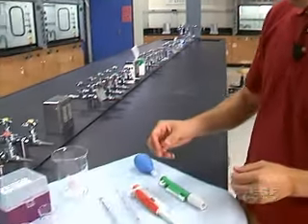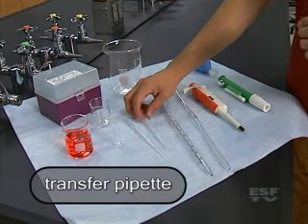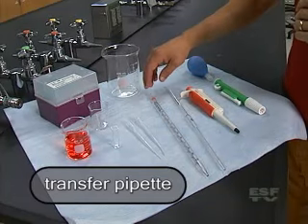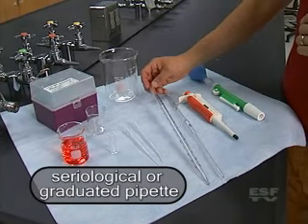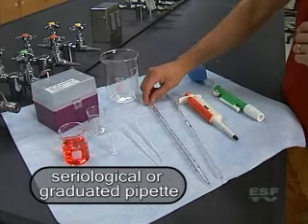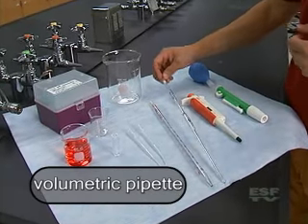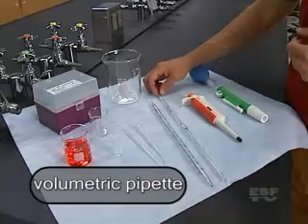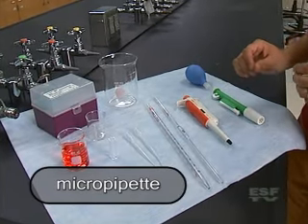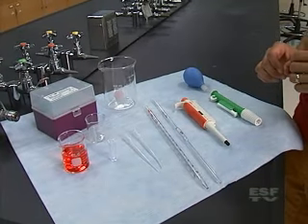First, we have a transfer pipette which is not necessarily very accurate but good for transferring solutions from one container to another. We also have a serological or graduated pipette which has markings in milliliter increments. We have a volumetric pipette which is very accurate, and a micro pipette. A micro pipette is good for very small volumes and you may use that in lab from time to time.